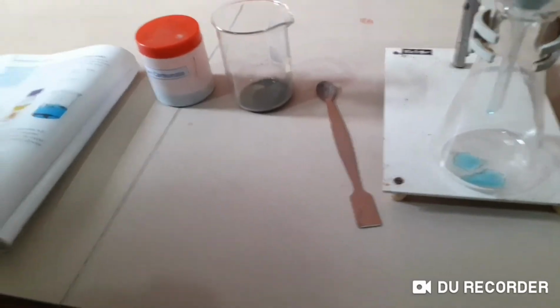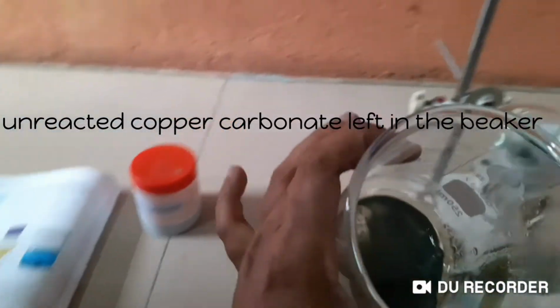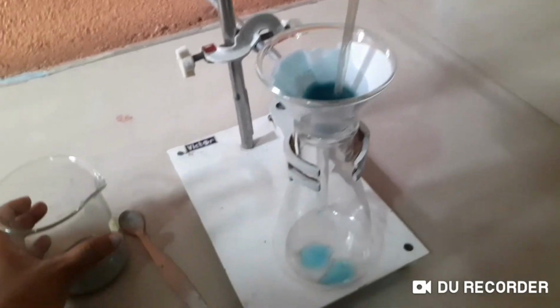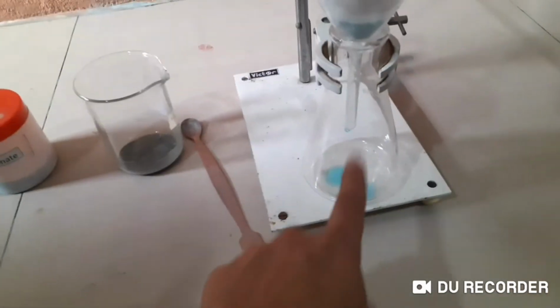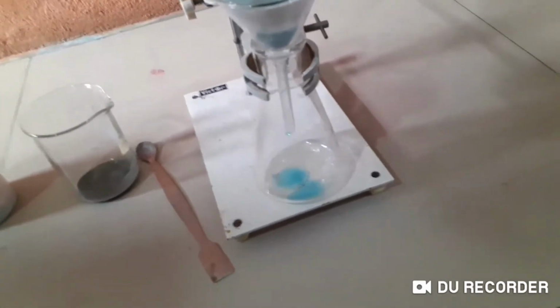Why did we filter? Because we are removing copper carbonate, right? There's extra copper carbonate here. We had to remove that. Yeah, we had to remove this extra copper carbonate. Can you see that, right? Excess copper carbonate. You understand that now, I think? Right, we are getting the solution. After we collect the solution, we are going to crystallize it. We are going to make the crystals out of it, okay?